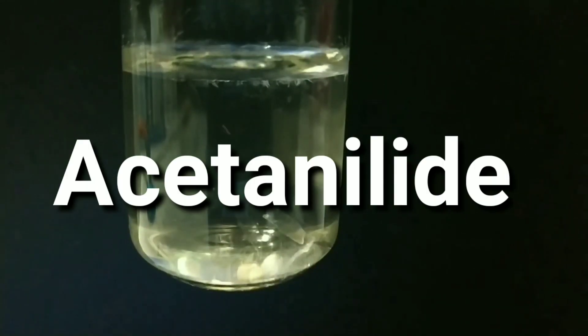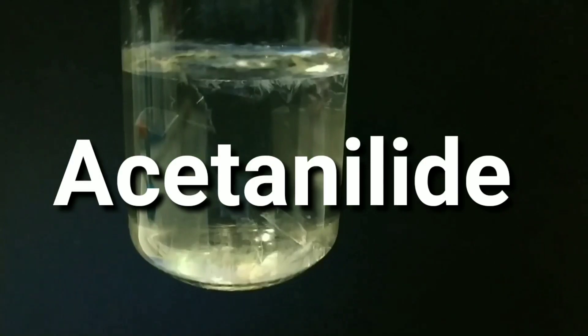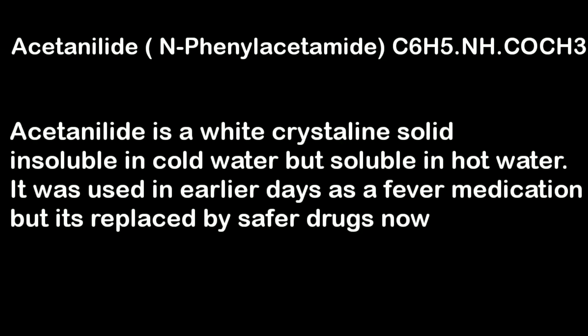Friends, today we will be synthesizing Acetanilide or N-phenylacetamide. It is an organic compound formed by the acetylation of aniline and it was earlier used as a fever medication.